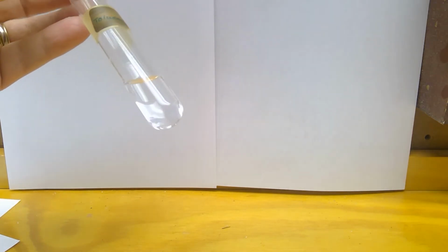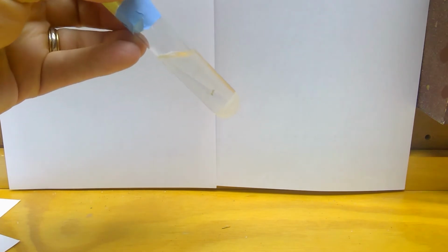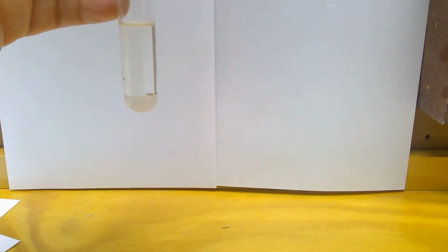And in F, we're doing toluene and NaCl. All right, so here's my toluene by itself. Here's my NaCl crystals again. And then this is what it looks like when we mix. Again, these are either soluble or insoluble.